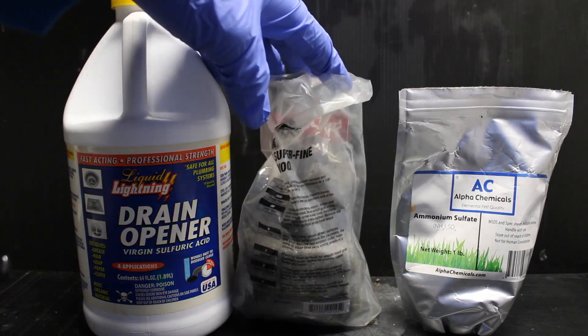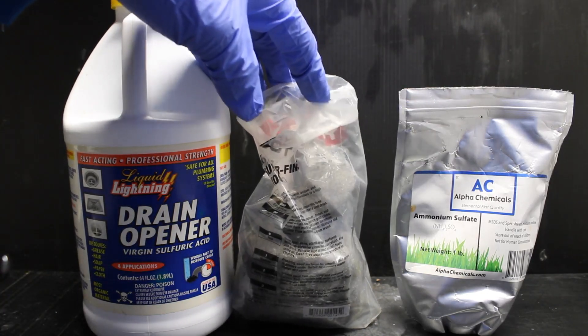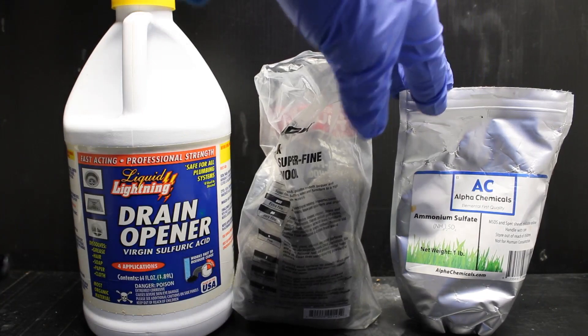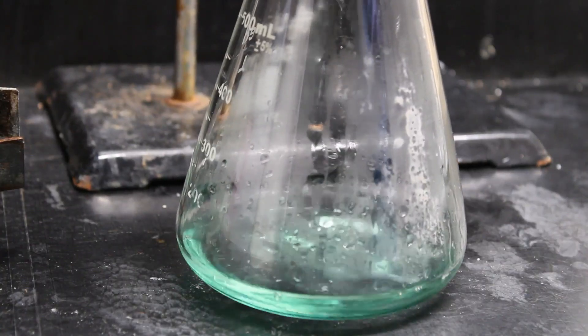Fine iron wool, or another iron source, and ammonium sulfate, which can be purchased as a fertilizer. So without further ado, let's get into it.